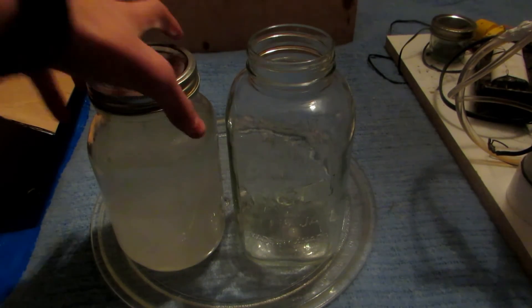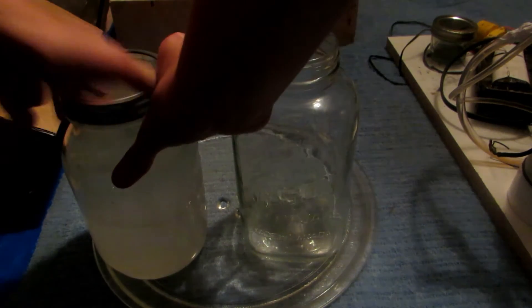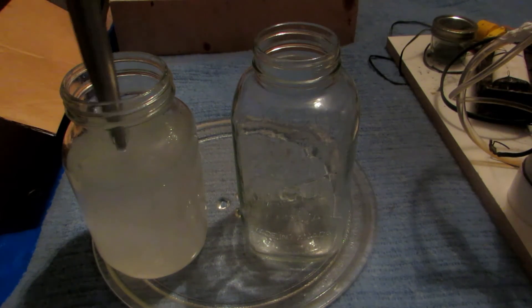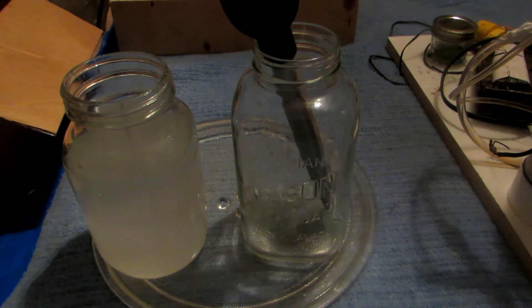It's formed what's known as an emulsion, but it is in two separate layers: our upper water layer and our lower dichloromethane layer, which is emulsified with the water — mixed together super well and very difficult to separate. This should be easily broken in a moment. I'm using a turkey baster, strictly used for chemistry, to suck off the top water layer into a separate jar. If you have a large separatory funnel I'd strongly recommend that, but I only have a 125 mL one so this is easier.